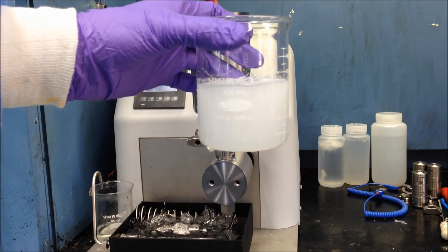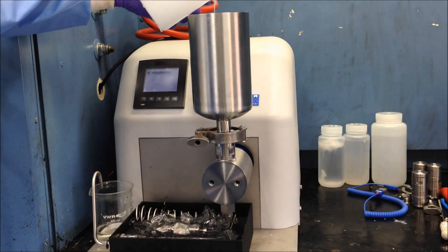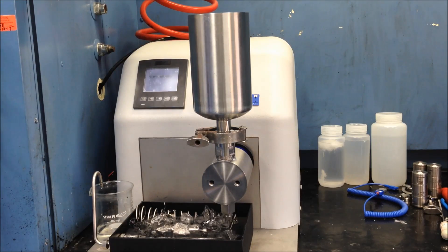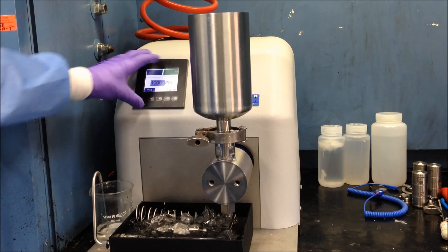Once we have a sufficient pre-mix, we can add the sample to the LM10 reservoir and begin processing. Because we have already primed the machine, we can begin processing immediately.